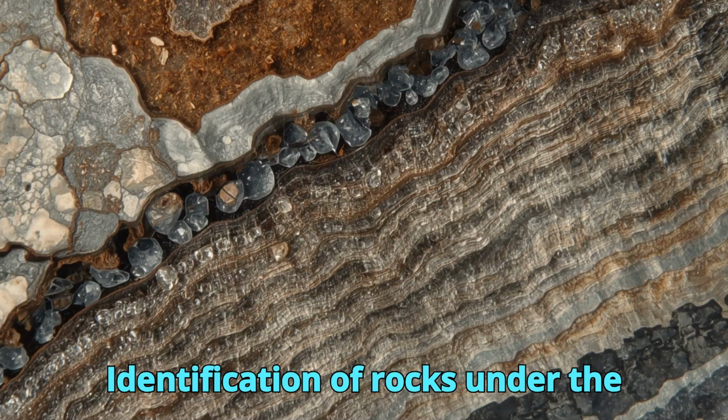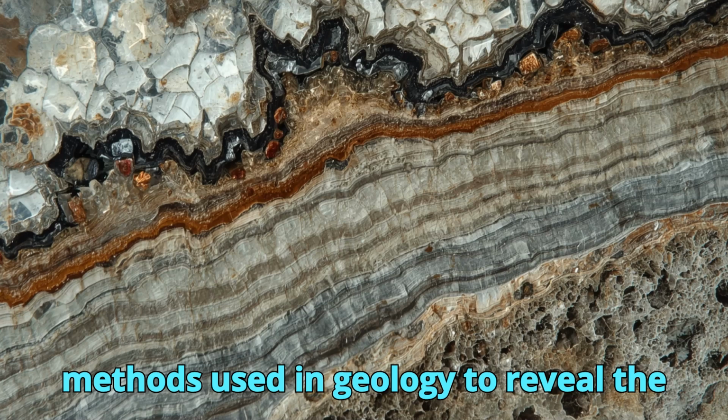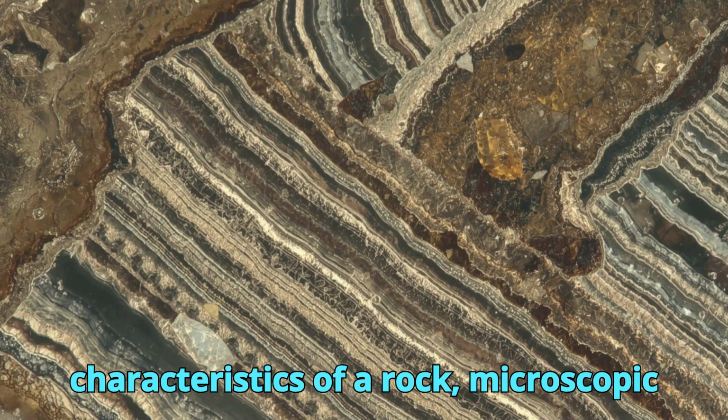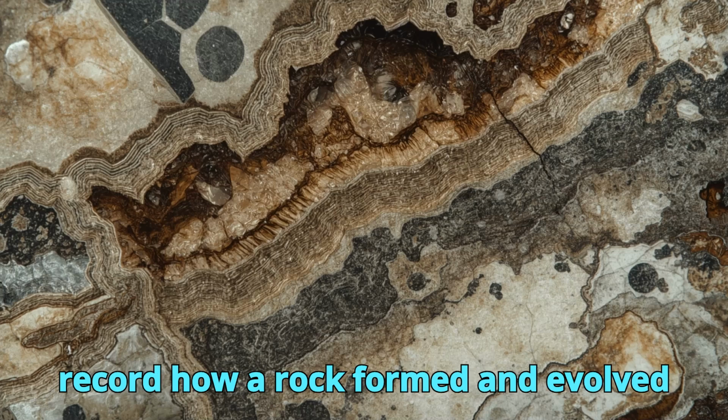Identification of rocks under the microscope is one of the most powerful methods used in geology to reveal the true nature of Earth's materials. While hand specimens show only the surface characteristics of a rock, microscopic analysis exposes the hidden world of minerals, textures, and structures that record how a rock formed and evolved through geological time.